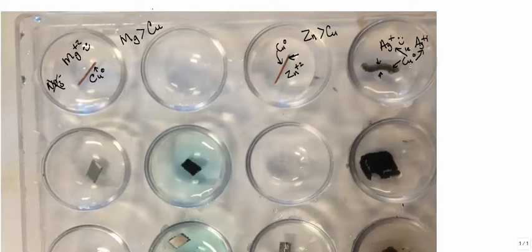So the copper will be able to actually dissolve into the solution. Over time, you'll see the solution begin to get blue. As this little woolly worm continues to grow more and more tendrils of what? What is that? That is silver metal.